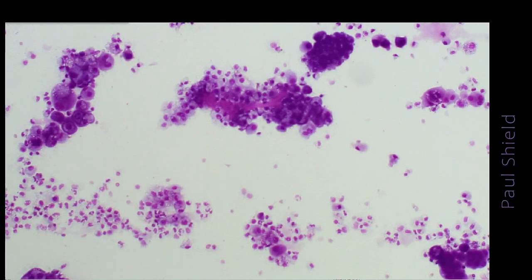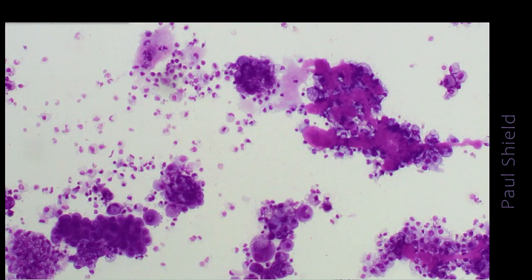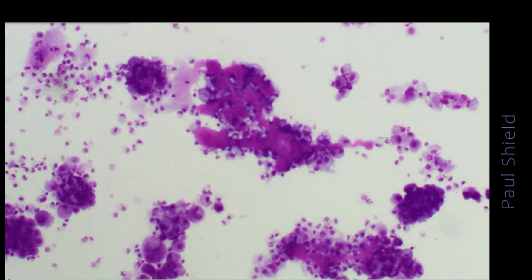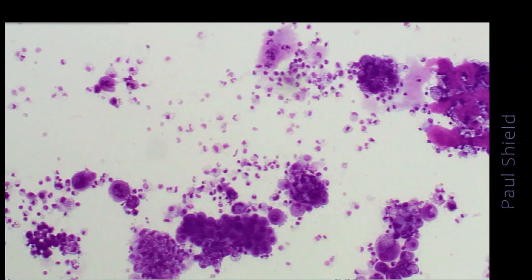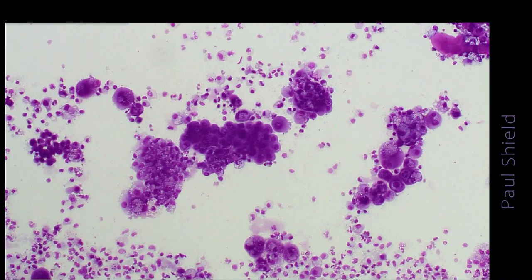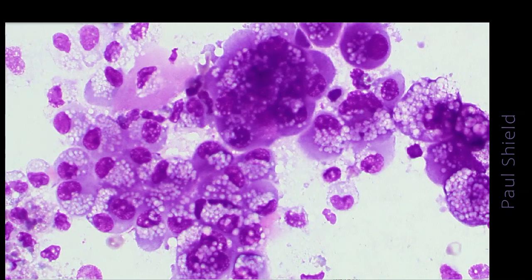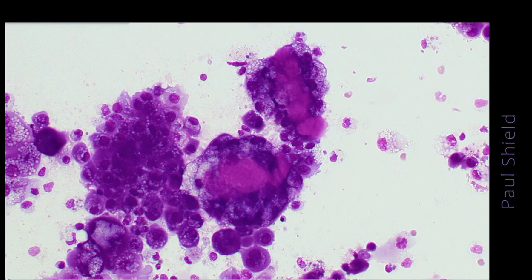Often, if the pap stain's working well, it'll be really bright aqua blue. On the Diff-Quik slides, it's this sort of magenta colour. You can see it streaking in amongst the cells here. And so unlike adenocarcinoma cells, these groups are solid because they're filled with this collagenous material. Notice here, the cells are retaining that mesothelial characteristic, and see the really bubbly glycogen that's present in these cells in that kind of perinuclear fashion.